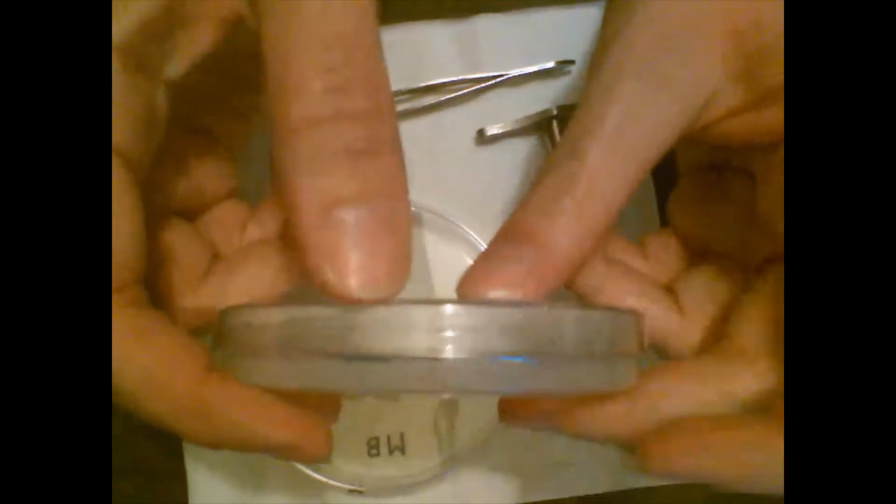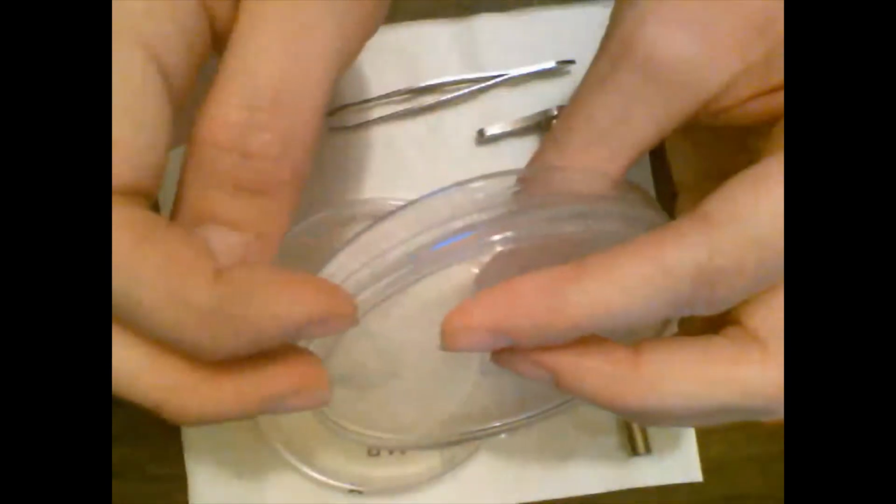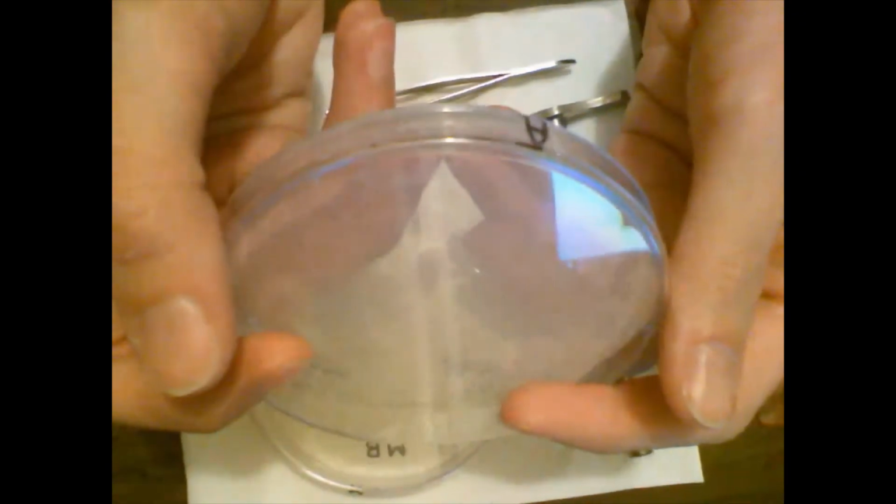It looks like this. You can see the material on the inside right here. This material has a jello-like structure, a little thicker than jello. These types of plates are usually used to grow bacteria. We usually have some sort of nutrients in it, and the bacteria will grow on these plates. But for our lab today, we're going to look at the effect weight has on diffusion.